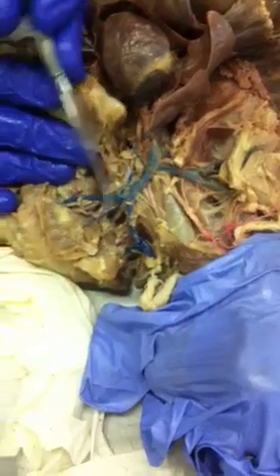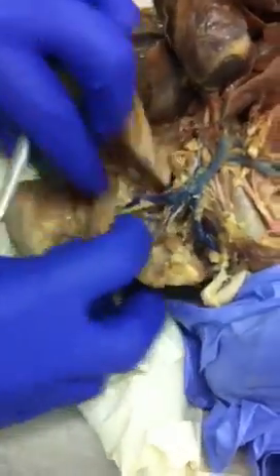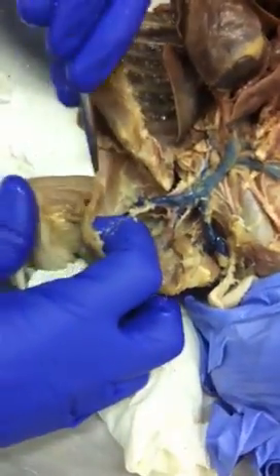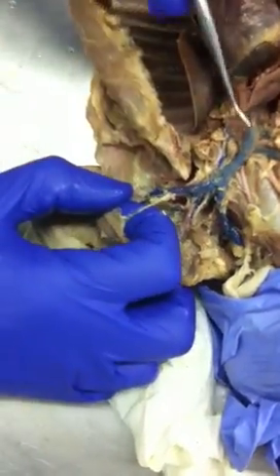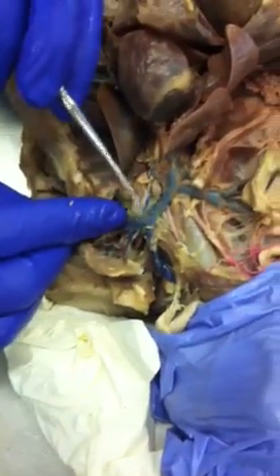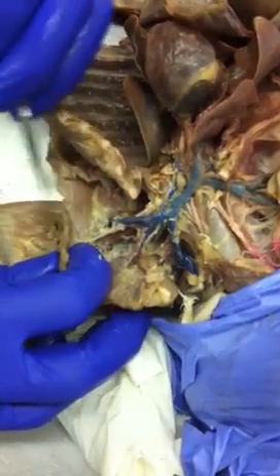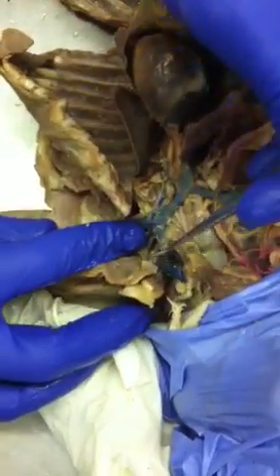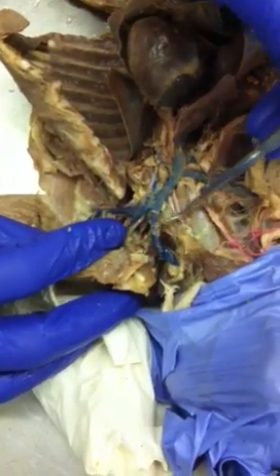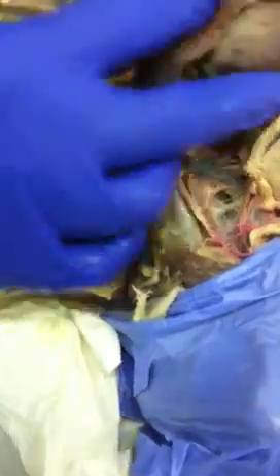After subclavian, you have axillary, armpit, basically that's what it means. And then in the arm, they dissected it back, but under here, it would be brachial in the arm. So if you just follow the same thing, this would be the vena cava, splits into brachiocephalic. At this point, it becomes subclavian, then axillary, and then brachial in the arm. Okay? And then up here, the big one, this is external jugular, and the small one is internal jugular, the blue right here. So that's everything up top.